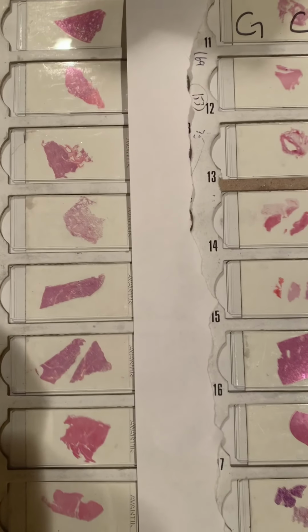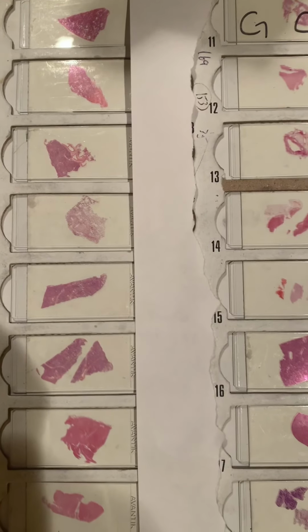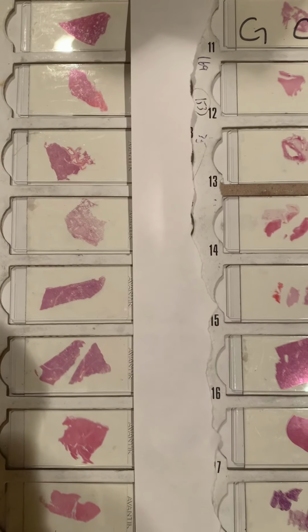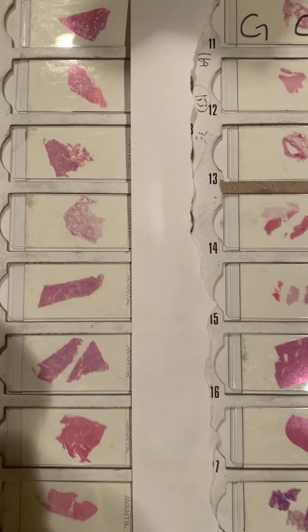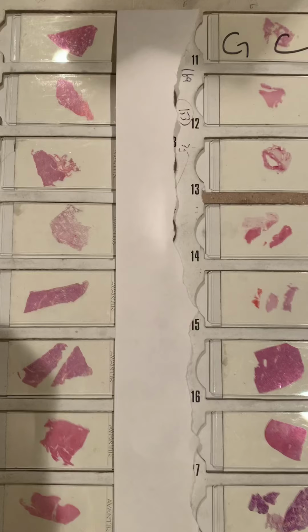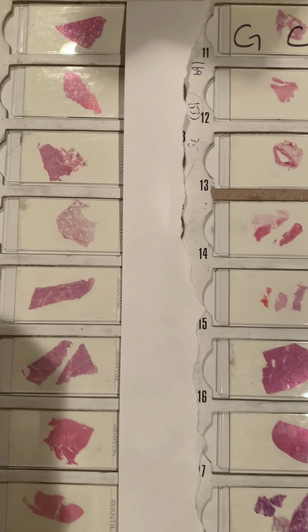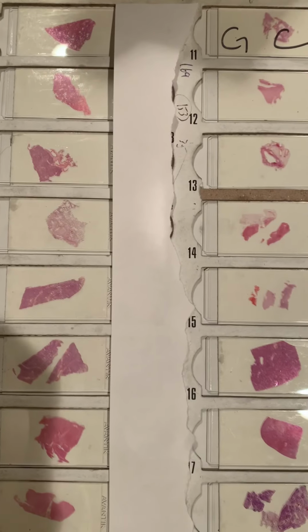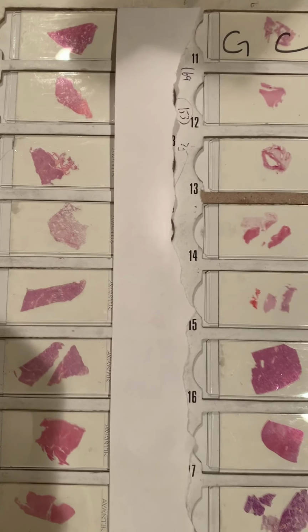So per a wise commenter on Instagram, my social media, in regards to the recent COVID-19 autopsy posting, the person had asked if I can post the video of some of the organs. So before I get started, I wanted to show you the sample tissue that I will be demonstrating via video.